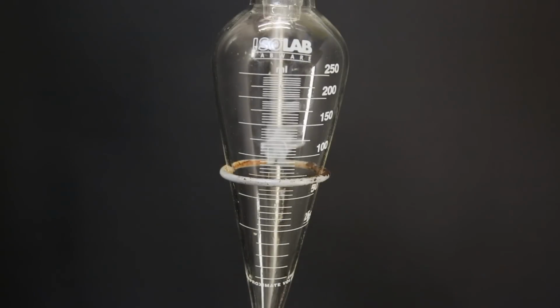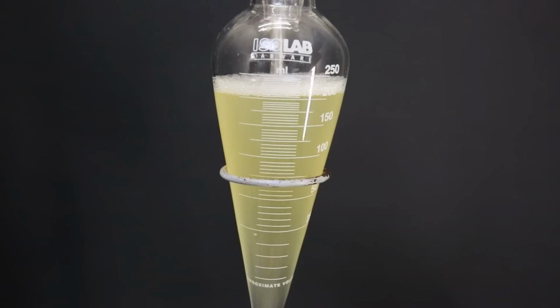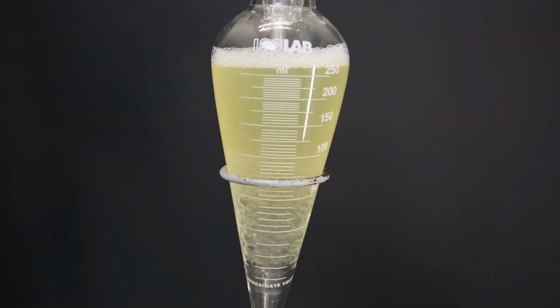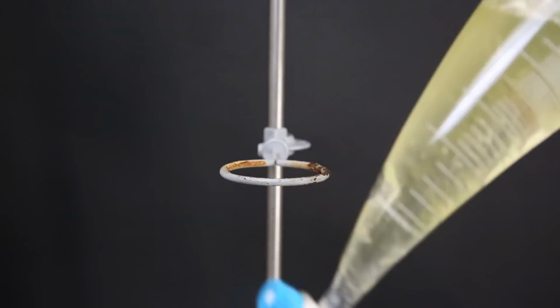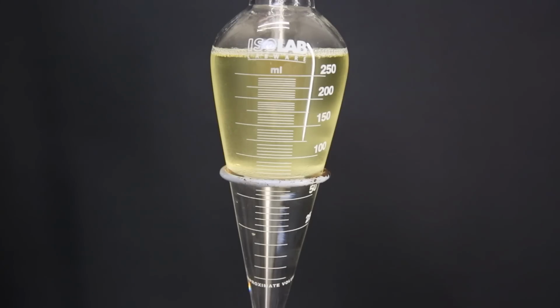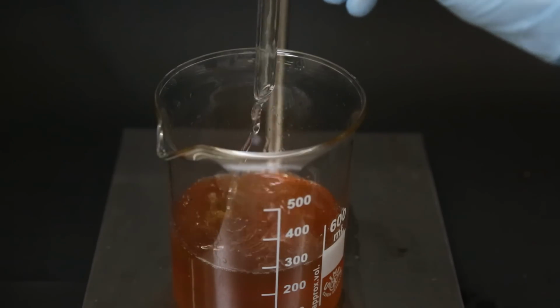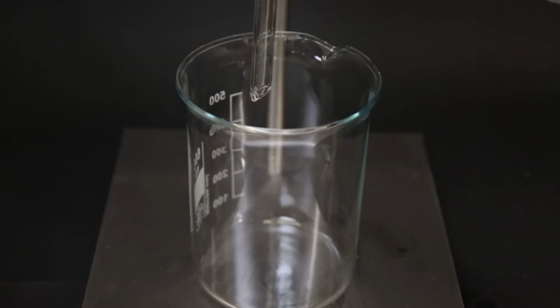Then I take the organic layer again and wash it with a 5% sodium thiosulfate solution. I discard the sodium thiosulfate solution in my beaker with the aqueous layer and drain the organic layer into another beaker.